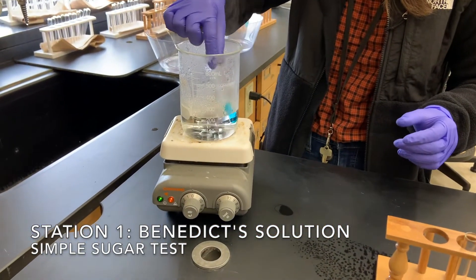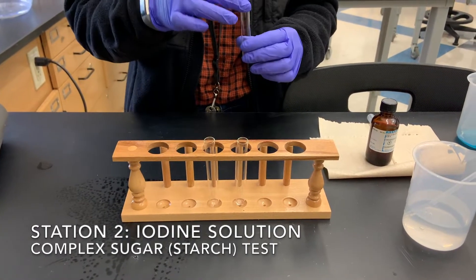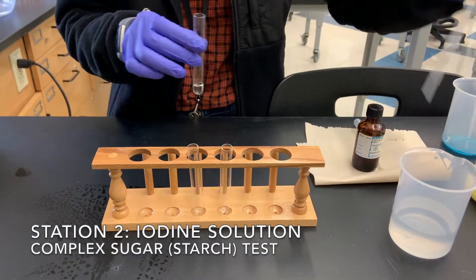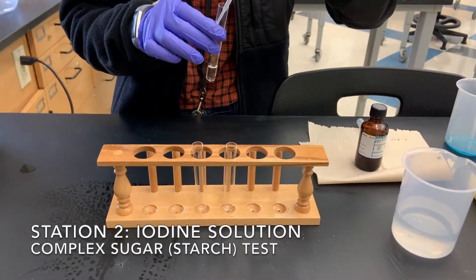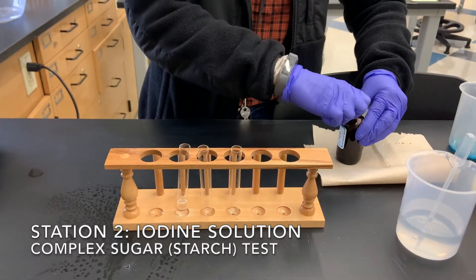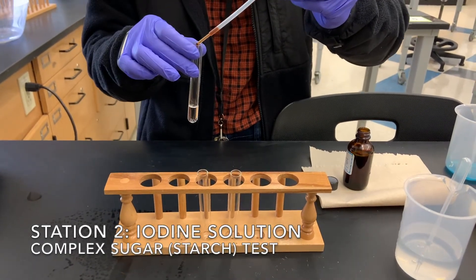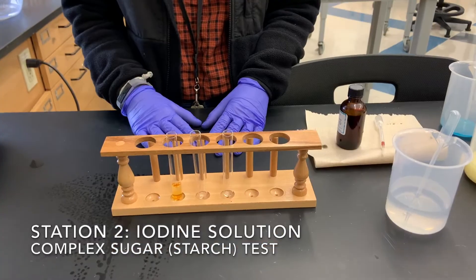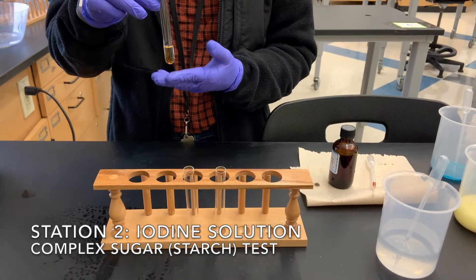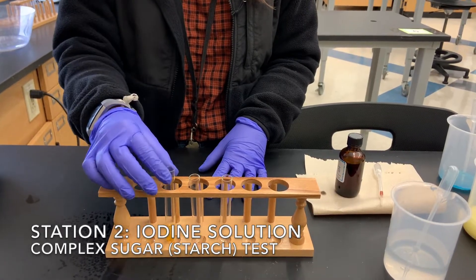I will show you what it looks like at the end of three minutes. For our next test, we are going to put water in our test tube again as our control, but this time two milliliters of water. For this test, we are going to use iodine solution. With iodine, this is an indicator for starches. If there was starch, the solution would turn bluish-purple-black. But as you can see, it's not that color, so we know our water control is working.